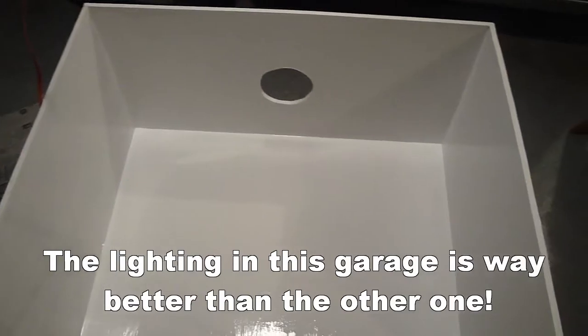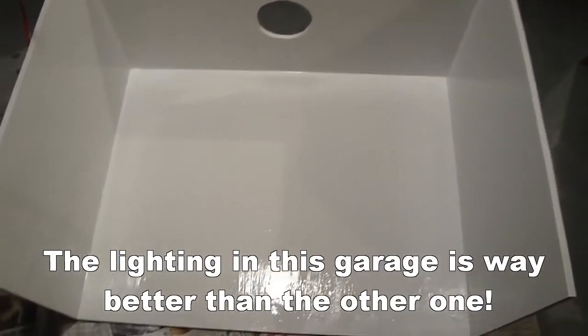So my spray paint wasn't working, so I just hand-painted the inside with this primer sealer we had. And we'll wait for this to dry maybe a day or two, and then we'll put on the plexiglass.